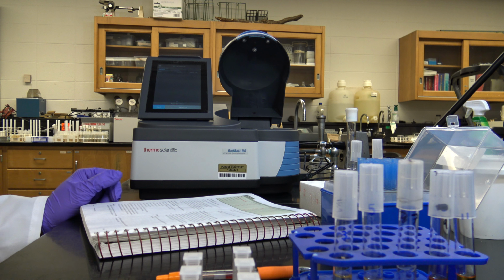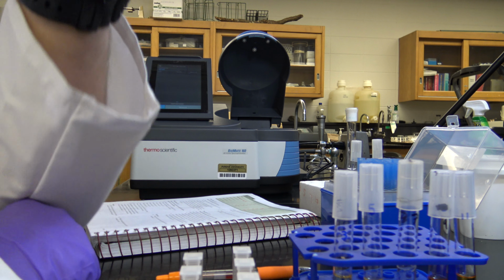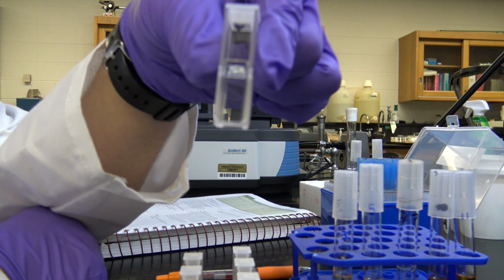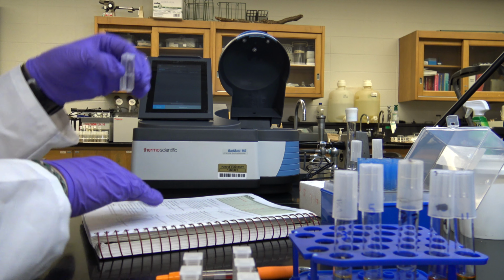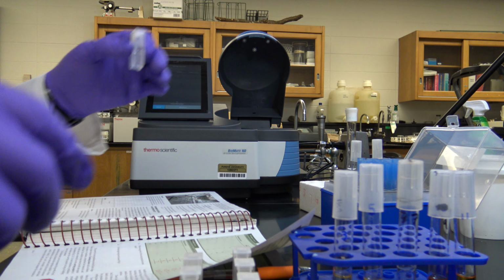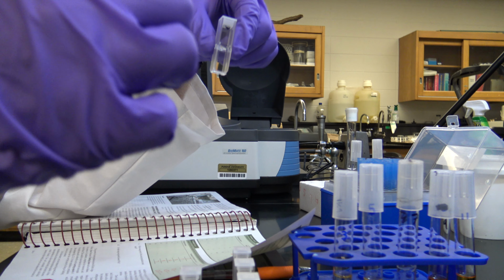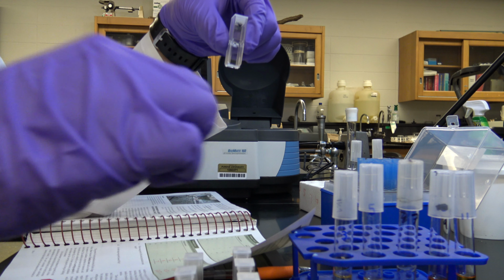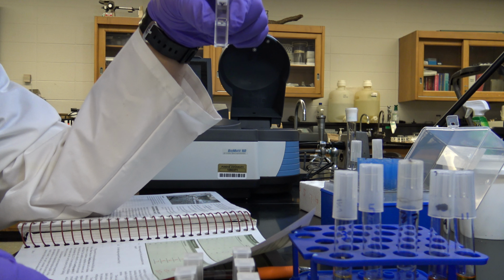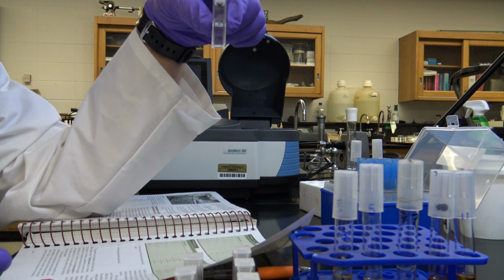So we're starting with, like I said, 22.1. With both of them, our blank is going to be water. I've already put water in a cuvette, and I realize that there's not a turbidity intensity for water on the thing, but that's fine. So what I ended up doing, actually, my 0 hour, I gave it a turbidity reading of 1. Again, you've seen it. My 4 hour has a turbidity reading of 2. My 8 hour has a turbidity reading of 4. My 12 hour has a turbidity reading of 6.